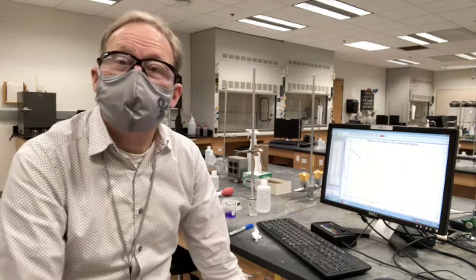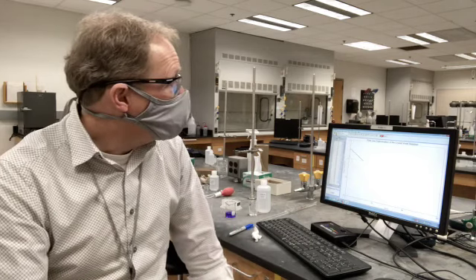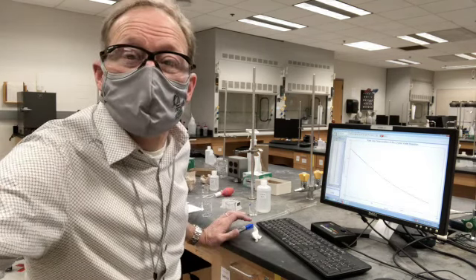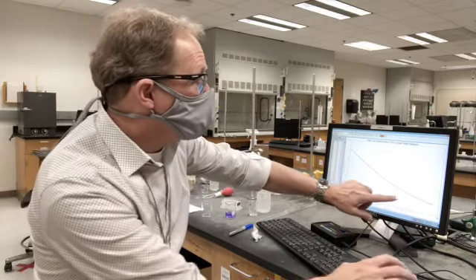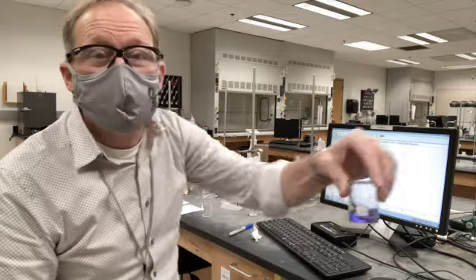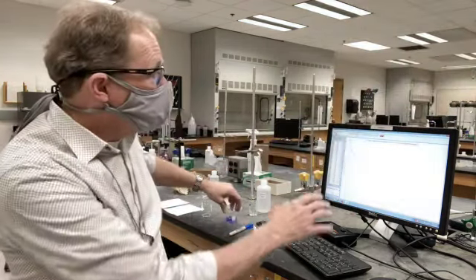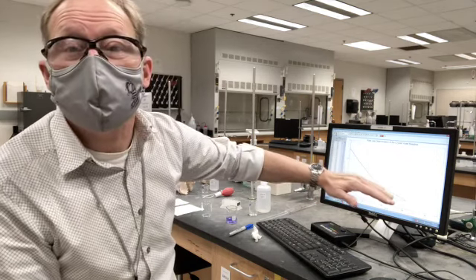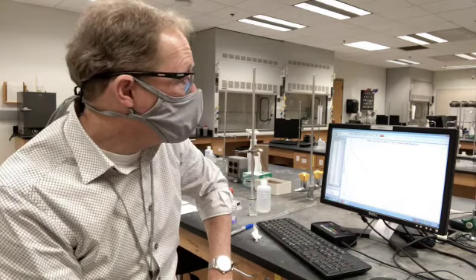This data I'm going to save in a file that you should be able to open up and then perform the analysis as described in the instructions. Our absorbance now is at 0.23, and we're getting pretty close to the end of our curve, so I'm going to extend this experiment for a little bit longer. Here you can see that the color is definitely not the same violet we had at the beginning — it's fading. All the spectrometer does is quantitatively monitor how that fading is happening with time. We're at 0.2, so we basically have all the data that we need in order to do our fitting. I'm just going to let it proceed a little further until we get to 0.1, and then I'm going to stop it.